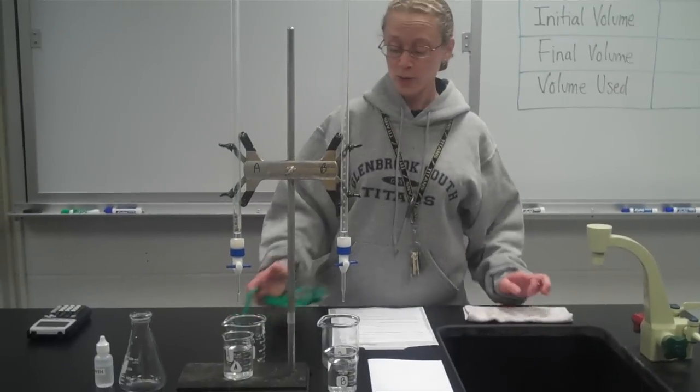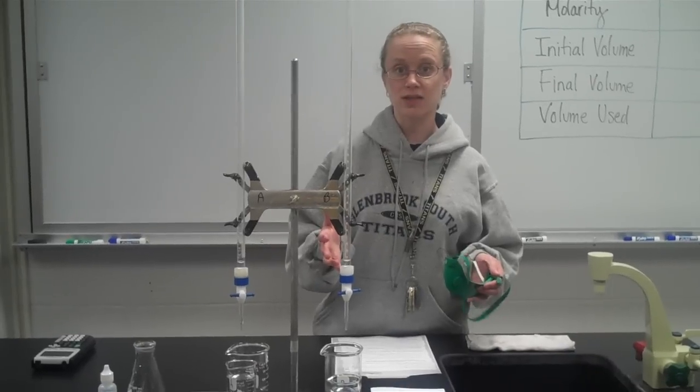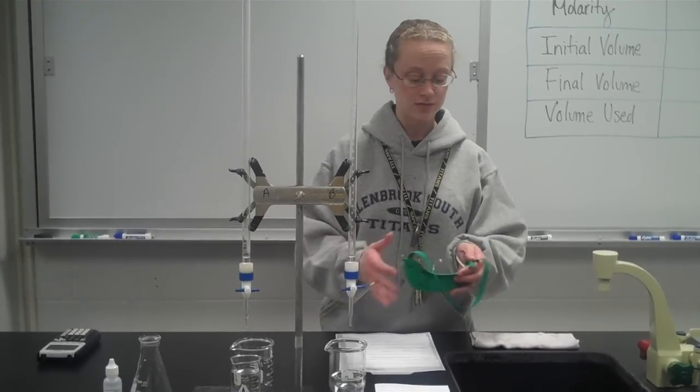Are we ready? Okay, Chem Studies kids, this is a demonstration of how to do a titration, the titration that you'll be doing in class yourselves.